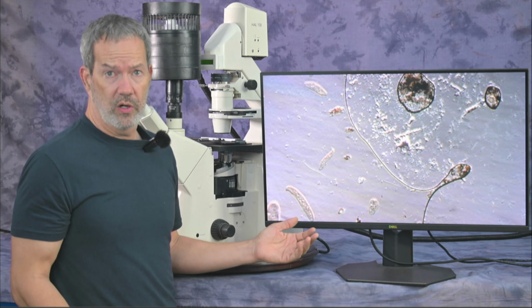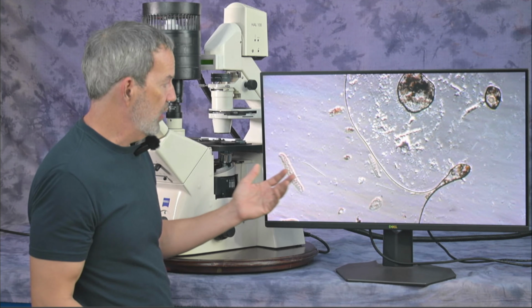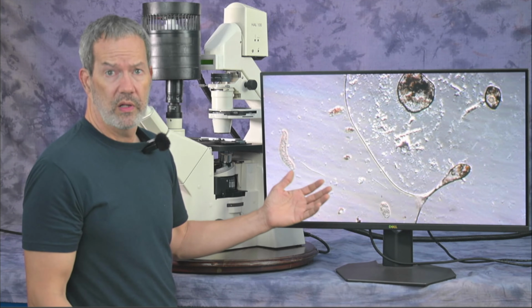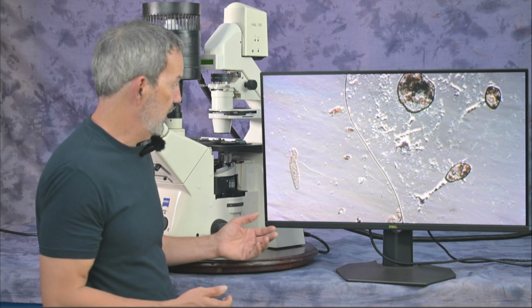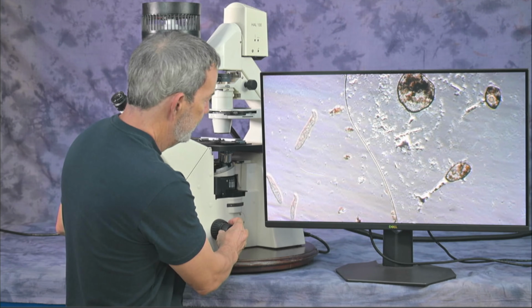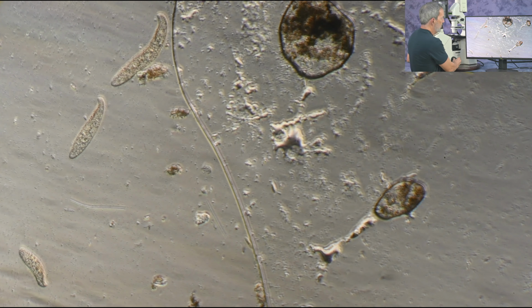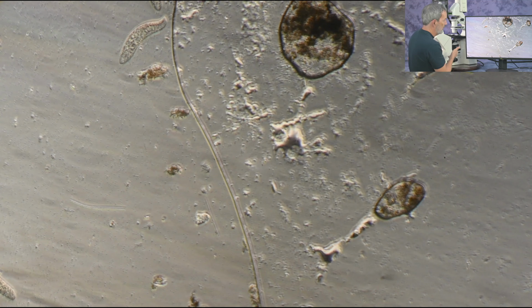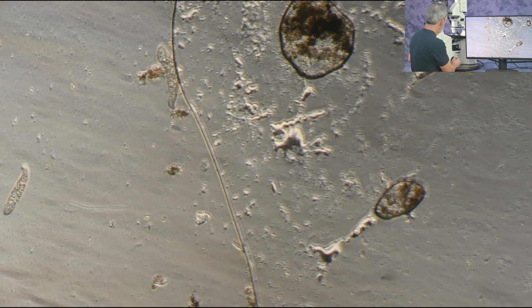As I told you earlier, we're not doing DIC, but Varel contrast gives you a pseudo 3D relief. So in a way, it's a very inexpensive way to get almost DIC. Maybe good enough for what you're trying to do. But I can assure you, if you put on the right DIC equipment and have a really good DIC image, it's still going to be better than Varel contrast.